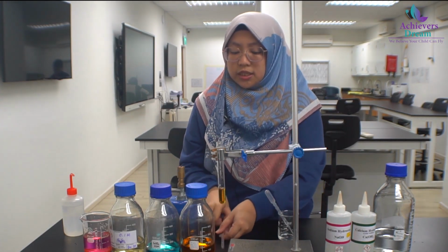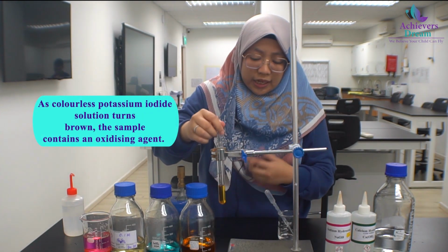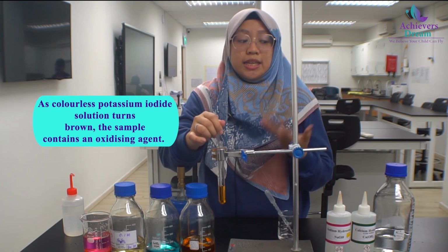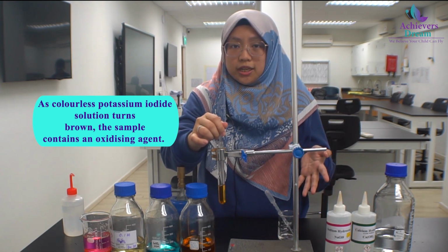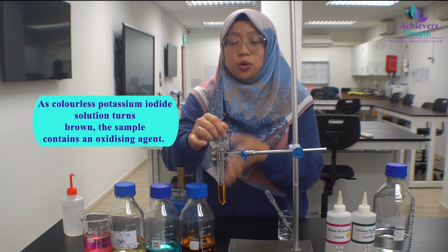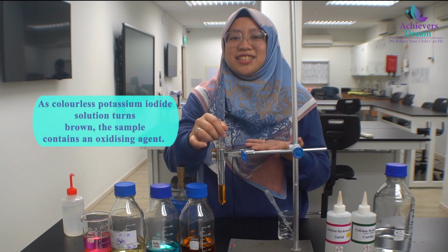Alright. So as you can see in this test tube, the final color of the solution is brown. So this indicates that acidified potassium iodide has turned from colorless to brown, indicating that the solution in the test tube contains an oxidizing agent.